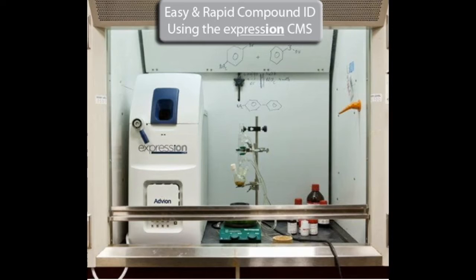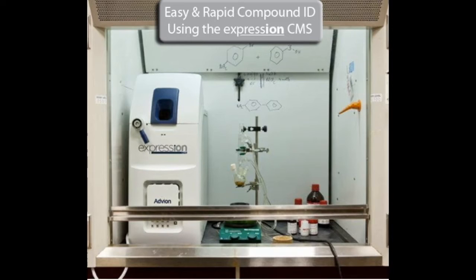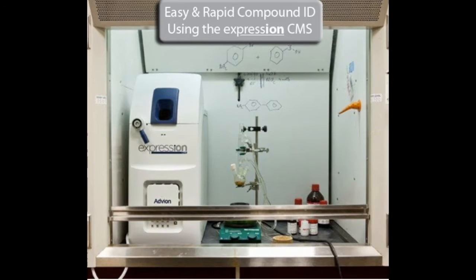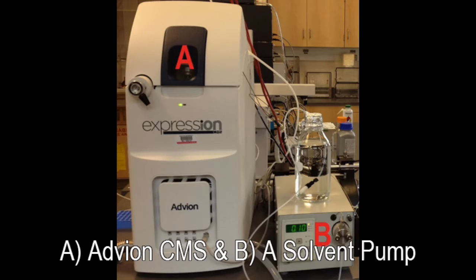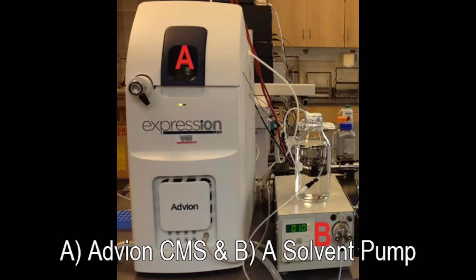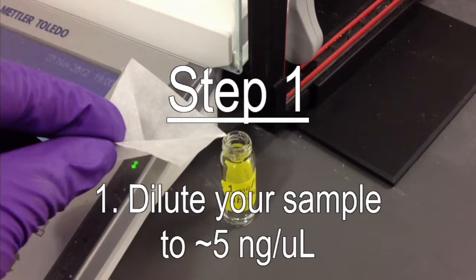Easy and rapid compound ID using the Expression compact mass spectrometer. You will need the Expression CMS connected to a solvent pump. First, prepare your sample.